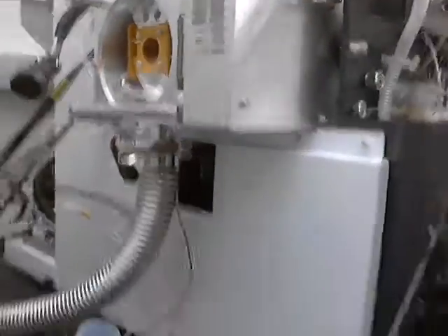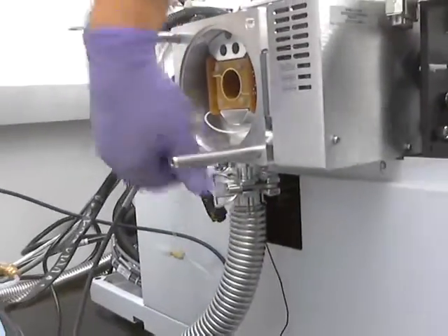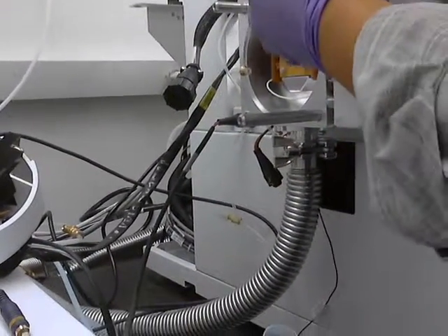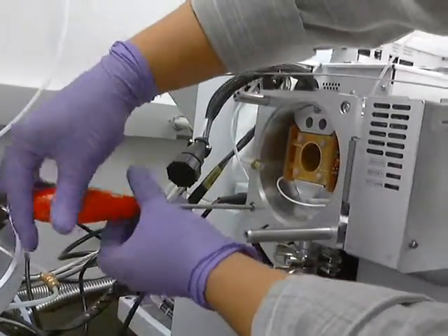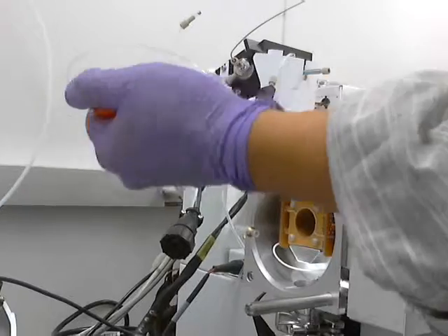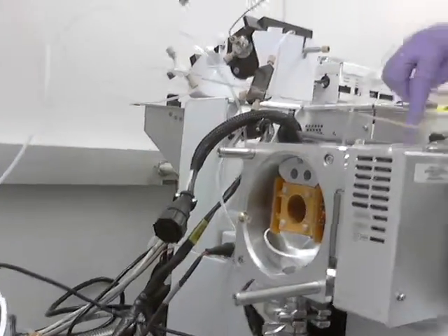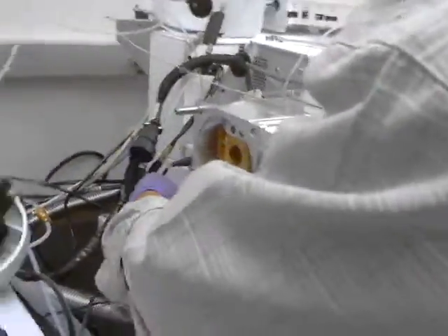Can you get that tight? Yeah, get it pretty tight. Just make sure it's lined up. Now let's go ahead and do these two screws. So you want to make sure you tighten these down and this part here is really flush up against this metal piece. You don't want any gaps inside there. So for example, if there's a piece of wire or something and you press it, you want to make sure that's flush. Even tightening.